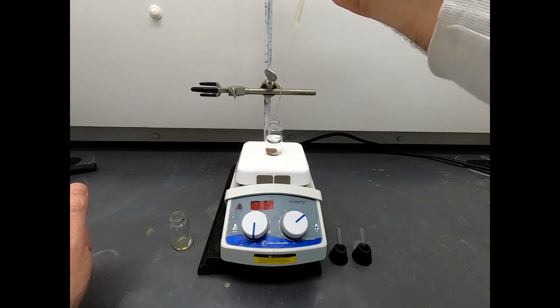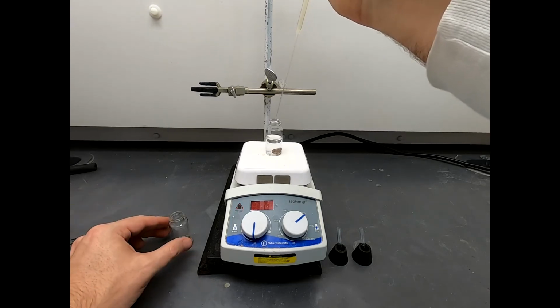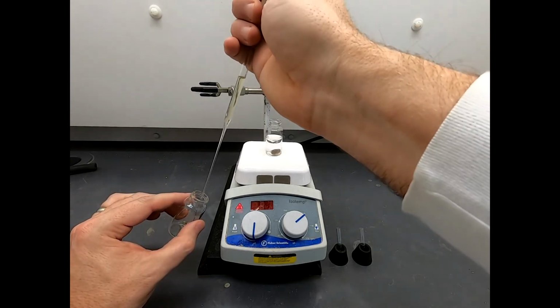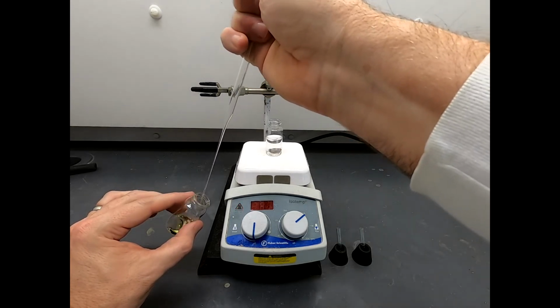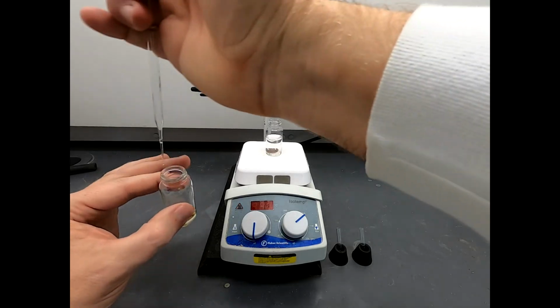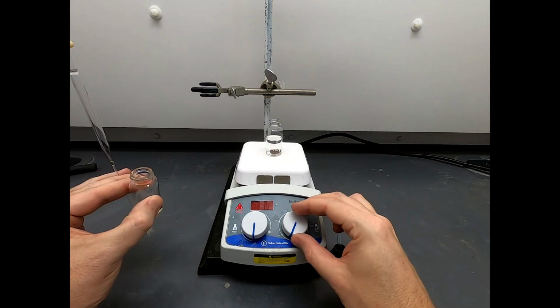I think that's solid. I will confess, I've done this reaction before. I didn't record it. And I did have trouble at this stage. I actually got quite a bit of oil out of the reaction. And it took a little work getting that oil to solidify. So I'm a little bit gun shy here about getting a solid. And the procedure does warn you about making sure things are vigorous and moving well. Typically in the precipitation, if you can get some solid, you're probably a-okay to continue.